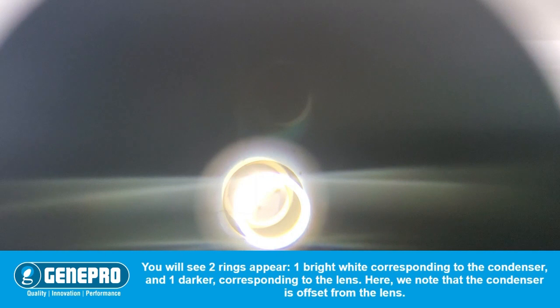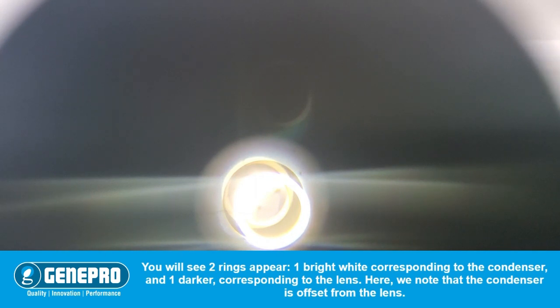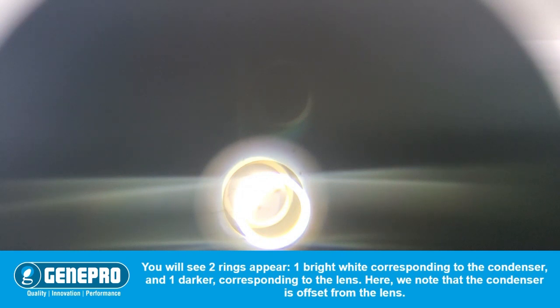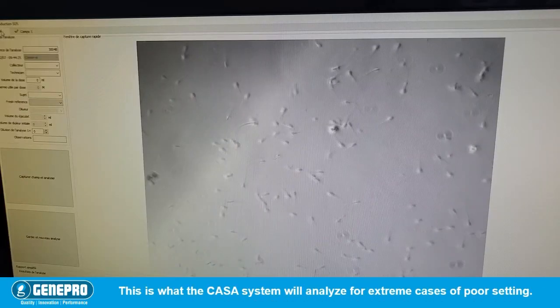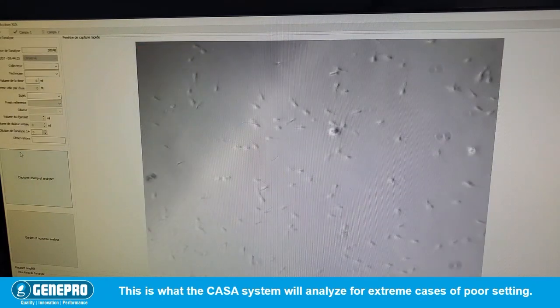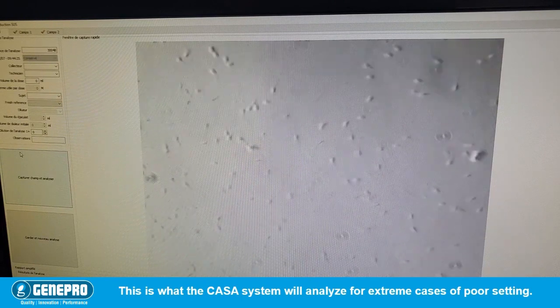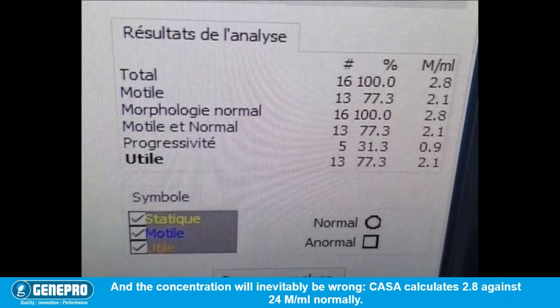You'll see two rings appear: one bright white, corresponding to the condenser, and one darker, corresponding to the lens. Here we can see that the condenser is offset from the lens. This is what the CASA system will analyze for extreme cases of poor setting.